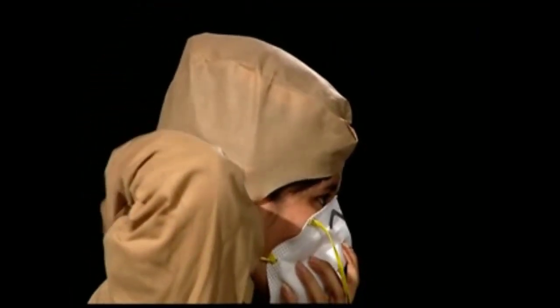This would custom fit the respirator over your face and will ensure safety.